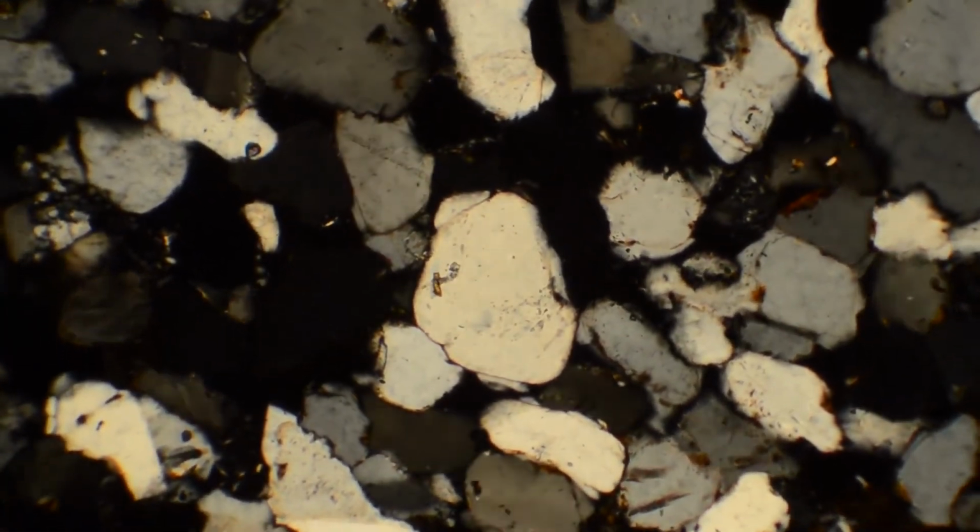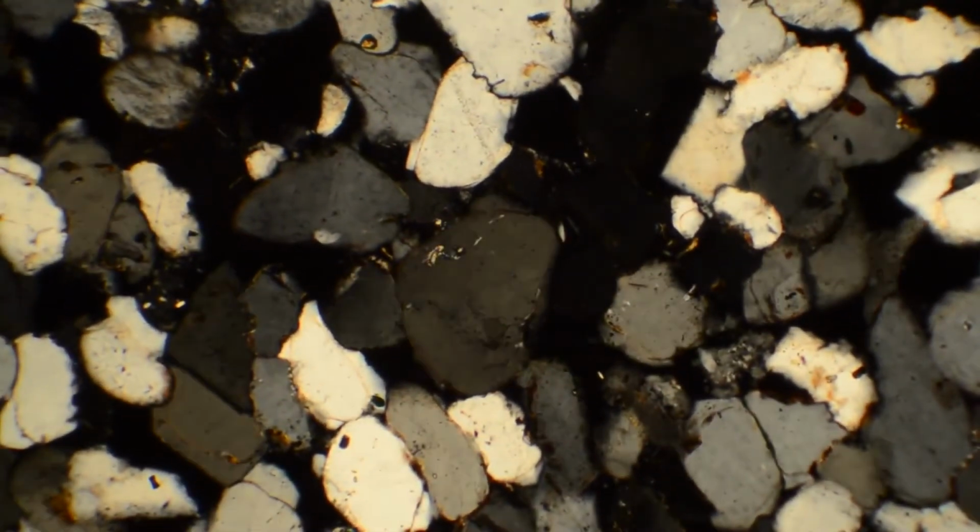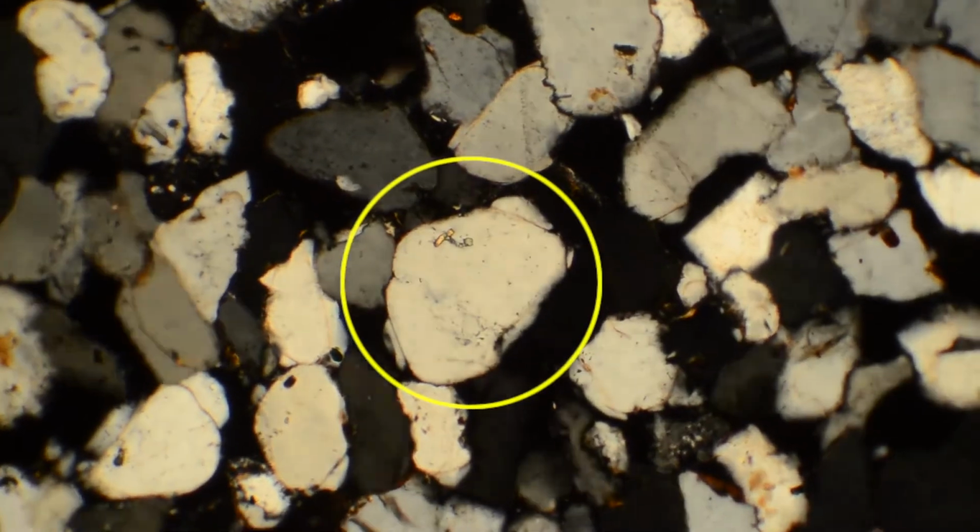Now, let's try an example together and proceed to characterize the grain. In this thin section containing mostly one type of mineral, I find the grain that exhibits the highest retardation. I switch to the highest magnification, focus, and insert the condensing lens and the Bertrand lens. Rotating my stage by very little, I notice a flash figure. I now know that I have picked out a good grain for characterization along principal axes.